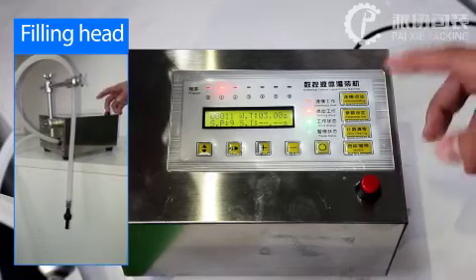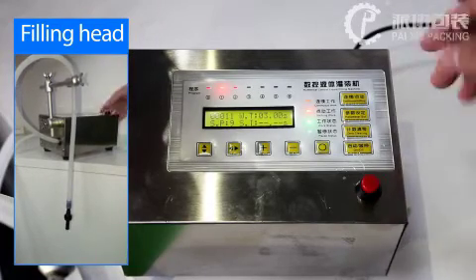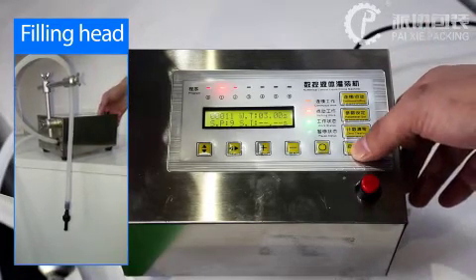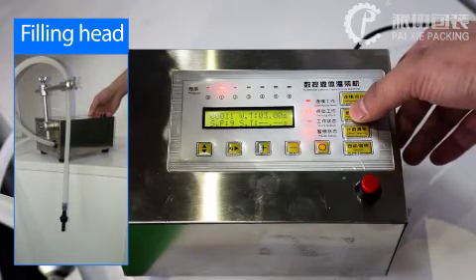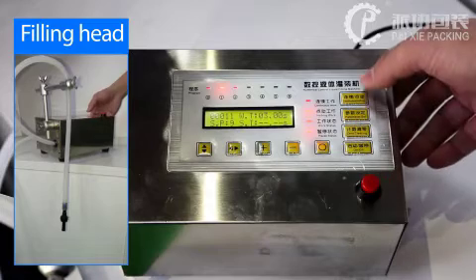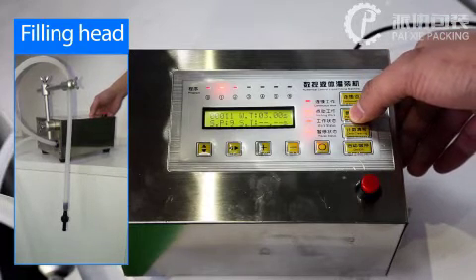If you want to change the parameter, you can press hold and press parameter setting button.